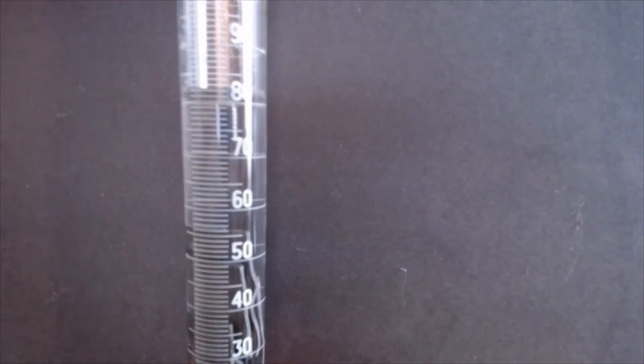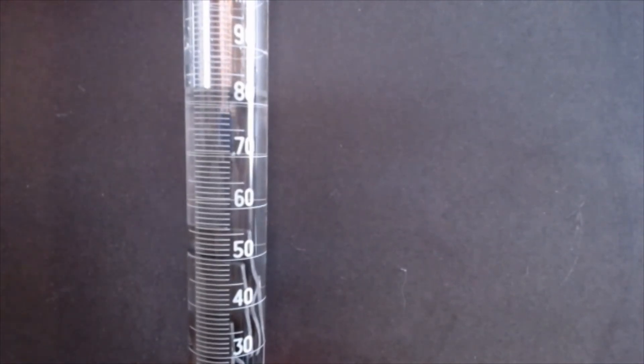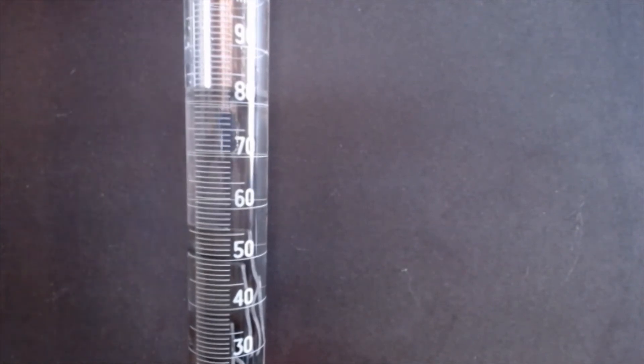Okay, as you can see, the lead pieces are in there, and let's see what we can do about the volume. All right. Again, not sure if you can make your own reading, but I'll give you a hand. But if you can make your own reading, go ahead. What I have, I have 82.0 milliliters, 82.0 milliliters for the lead as the final volume.